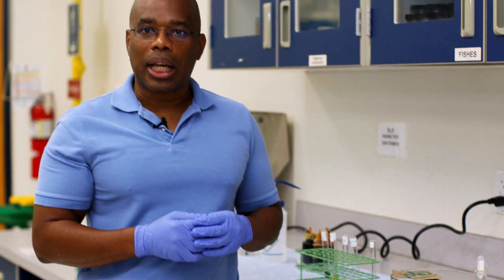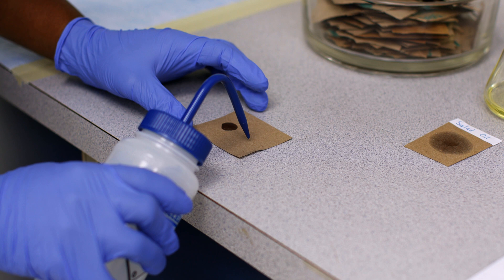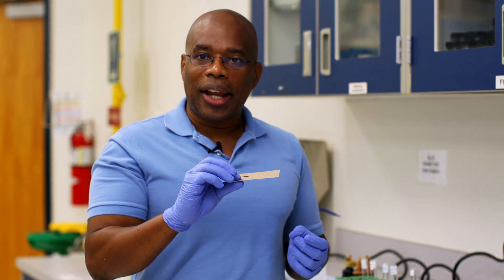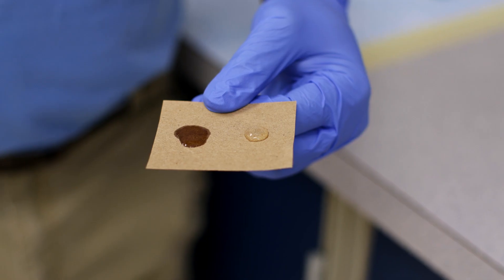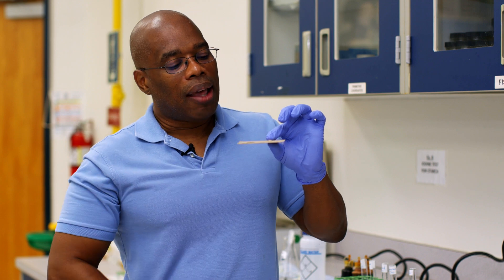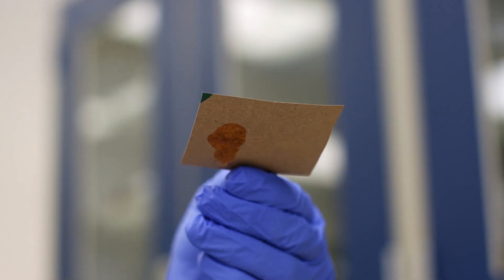To contrast with the salad oil, I'm going to add a couple of drops of water, which we know is a negative control because it's not a fat or oil. Now we can look at how each of these solutions interact differently with the paper. You can clearly see that the salad oil is being absorbed by the paper, whereas the water may be wetting the paper but is not being absorbed. If I look at the reversed end of the paper, I can now see a greasy spot appearing on the opposite side — and this is why we call this the Spot Test.